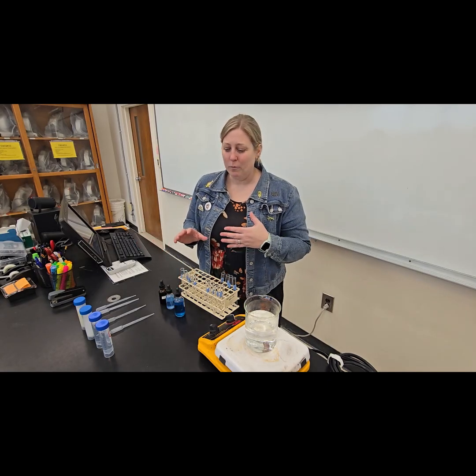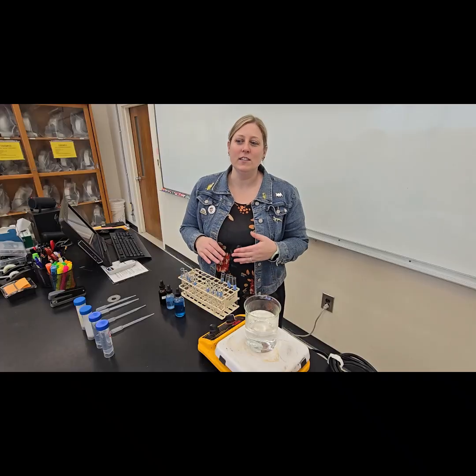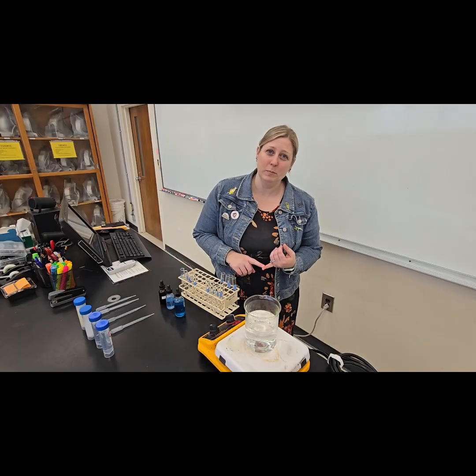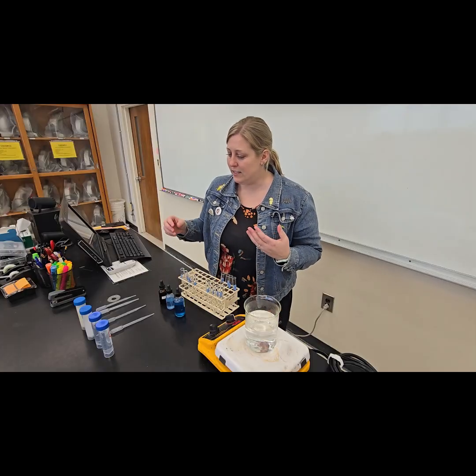All right, welcome to today's extension activity. So when you're in a seated lab, we tend to do these experiments where we're going to test food and different items for the macromolecules that we're interested in. Specifically, we're going to talk about glucose or simple sugars, starches, or proteins. Today, I am going to do that for you, and you're going to make your own hypotheses based on your understanding of foods that are in your environment, as well as the positive and negative controls for the tests.